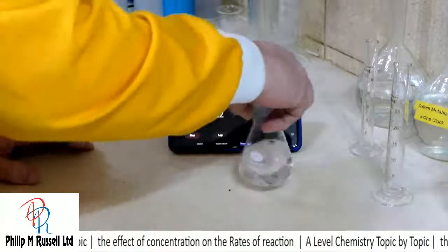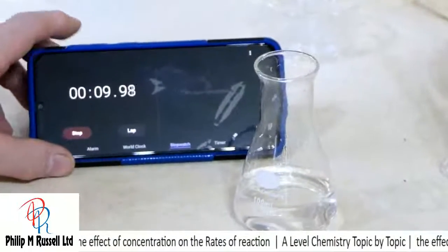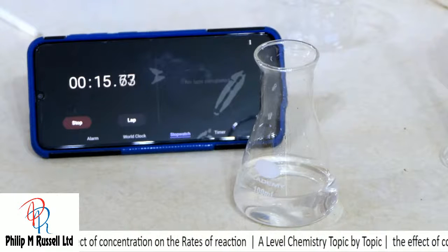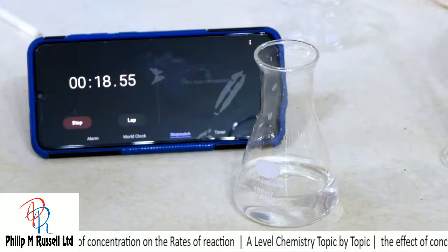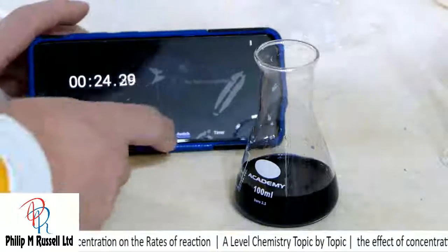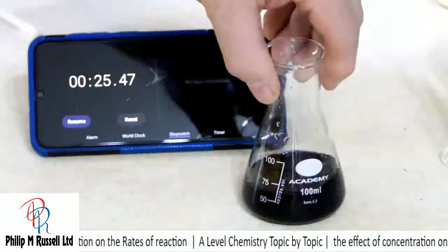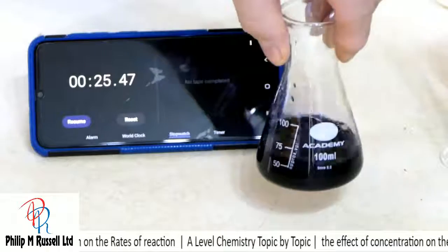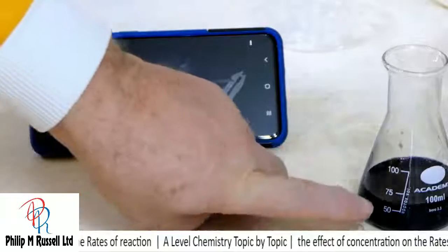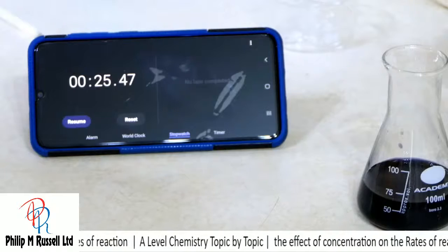I'm going to give this a good mix, and we leave it, and you see that nothing happens. It just stays like this, no problem at all, nothing, and then suddenly it goes around about there, about 20 seconds or so. And so this affects, because we've got basically a slow reaction and then a very fast reaction going ahead.